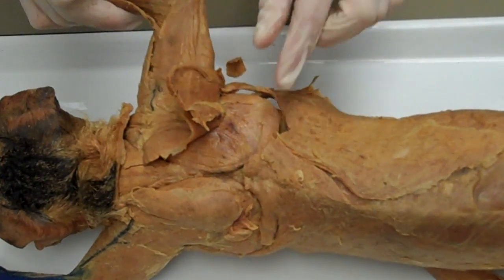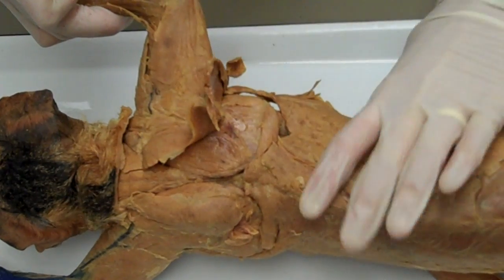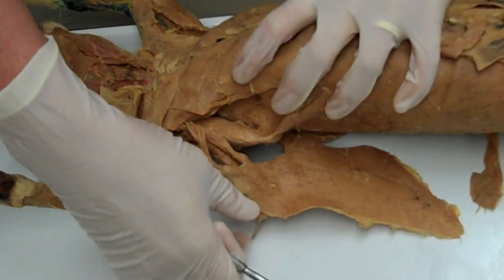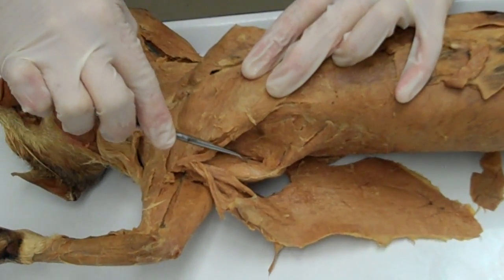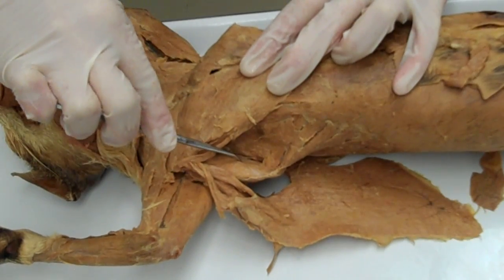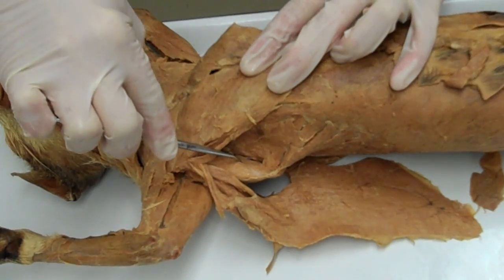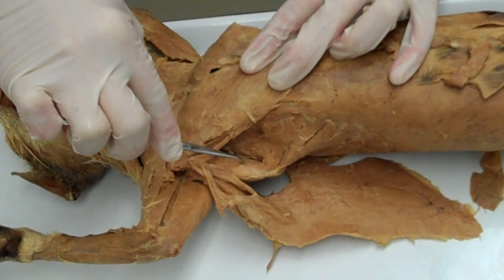One more muscle I'd like to show you is the subscapularis, which can be easily seen if I move the cat back to a supine position. This muscle is the subscapularis. Its origin is in the subscapular fossa of the scapula. It inserts on the lesser tubercle of the humerus, and its actions are medial rotation of the humerus and stabilization of the shoulder joint.